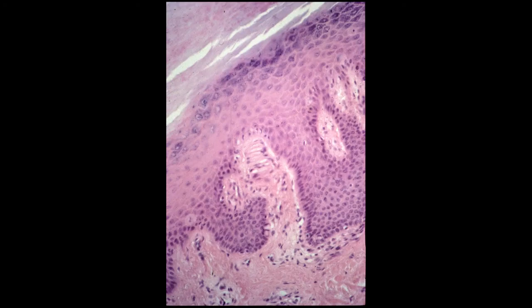Here is a Meissner's corpuscle. Meissner's corpuscles are touch receptors that are located in the hairless regions of the skin. You find them within interdigitations between the dermis, which is down here, and the epidermis here. And I'll remind you, since this is skin, this is a stratified squamous epithelium with keratin. The dermis is an irregular connective tissue. You can see the Meissner's corpuscle that I'm highlighting here.